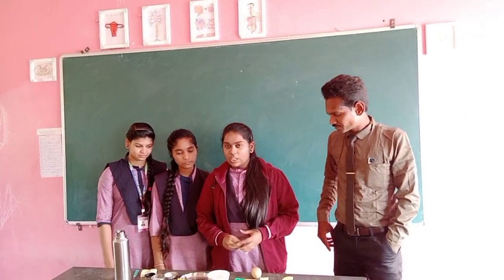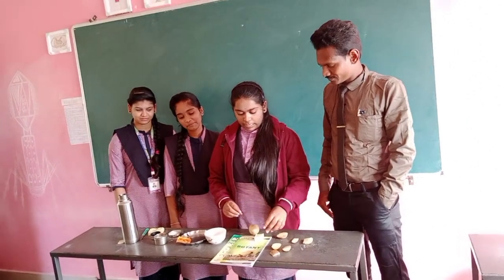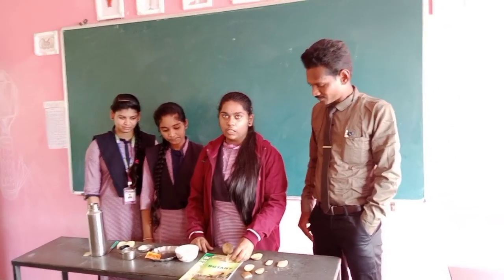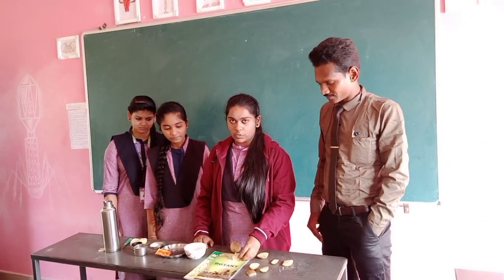Please. I'm Bhavna. Now I'm taking an aim called osmosis, to prove osmosis, that is endosmosis and exosmosis.